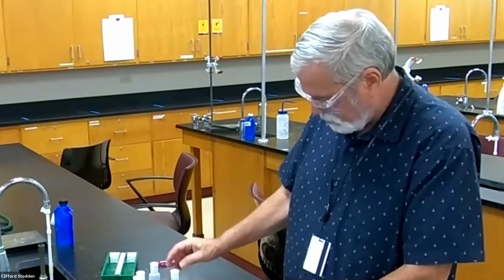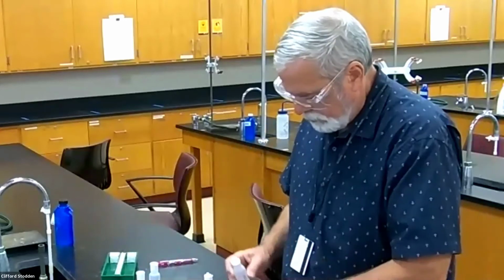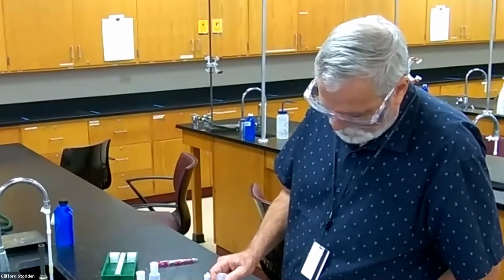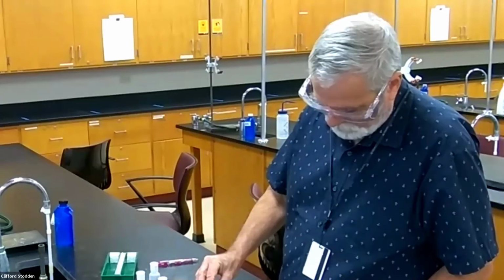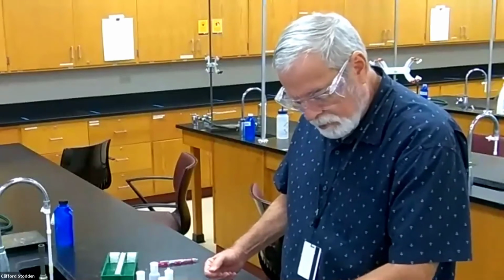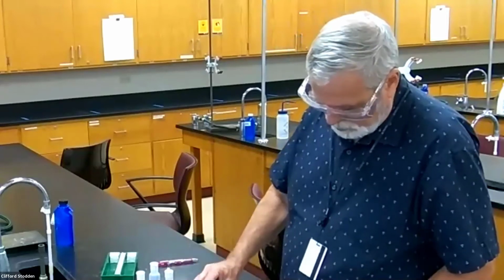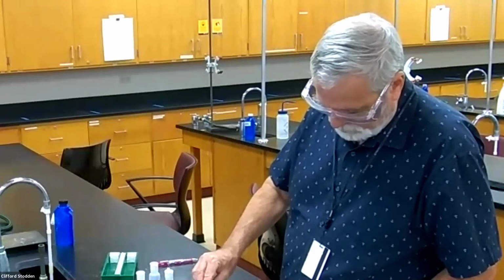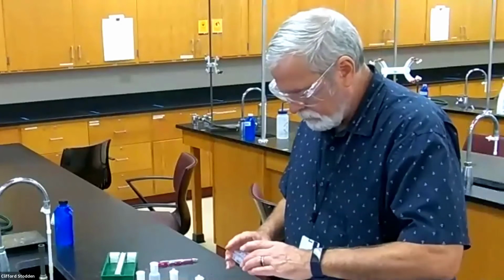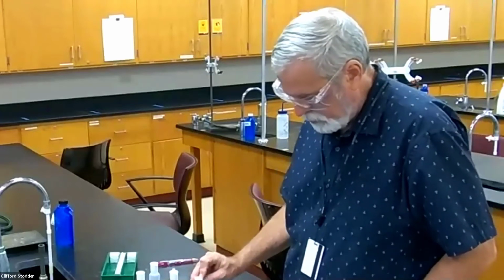A little bit. So that's the barium chloride, and sulfuric acid is here. Barium is an exception to the general rule that sulfates are soluble, so let's see if that holds up here. Very, very milky white there as well. Now, again, barium chloride with ammonia. This might also form a precipitate because we have some hydroxide in there. I'm not seeing anything very pronounced, but there might be a hint of a little bit of cloudiness there. It's kind of hard to tell.